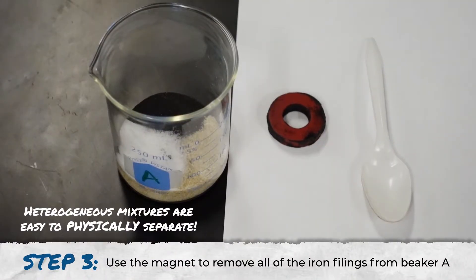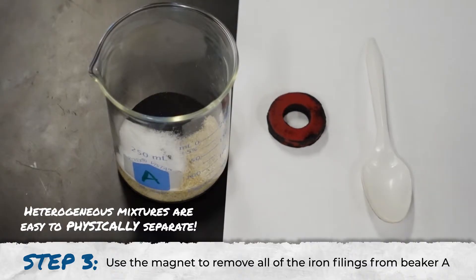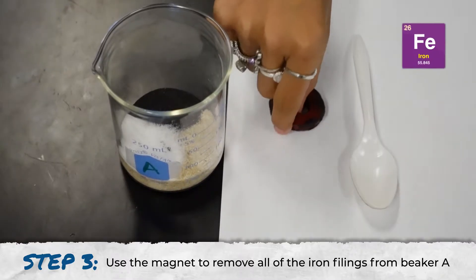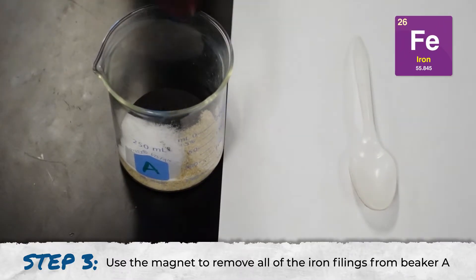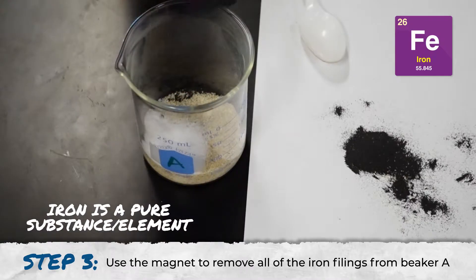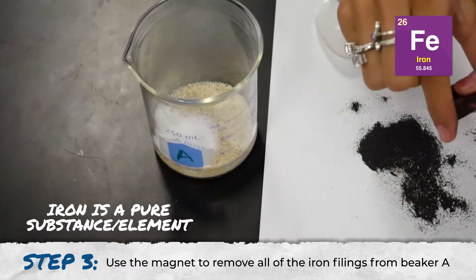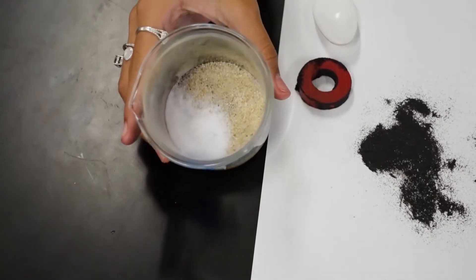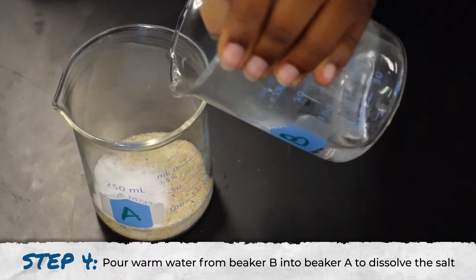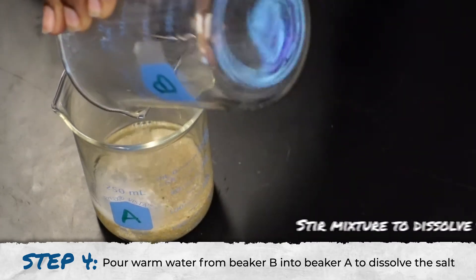Heterogeneous mixtures are easy to physically separate. First, we're going to use the magnet to remove the iron filings. Next, we're going to remove the salt from the sand by dissolving the salt in warm water.